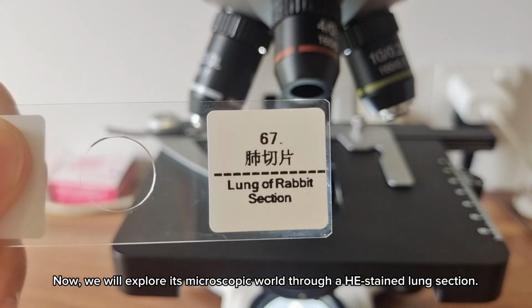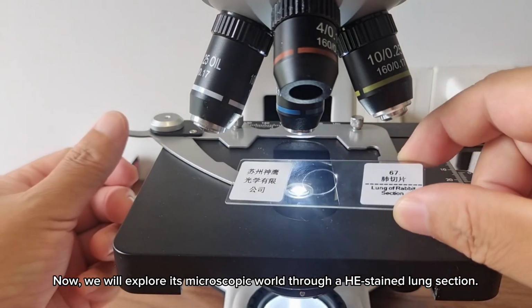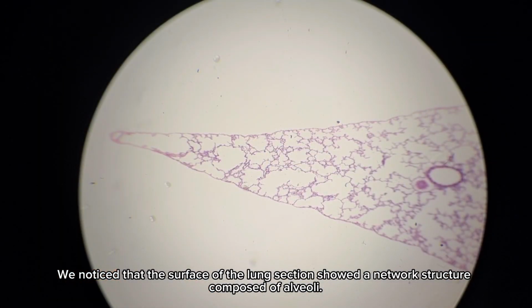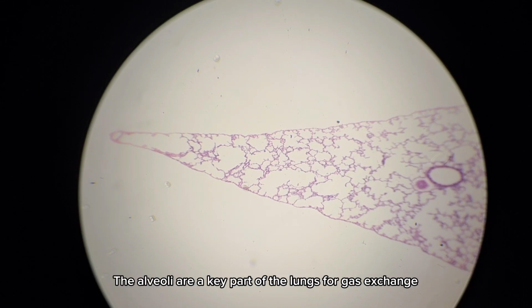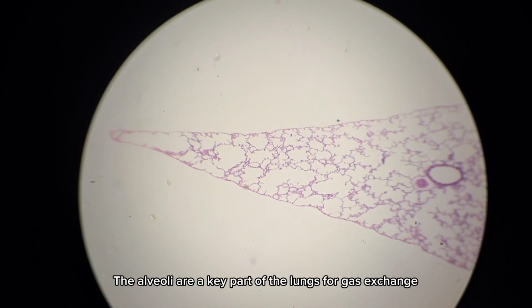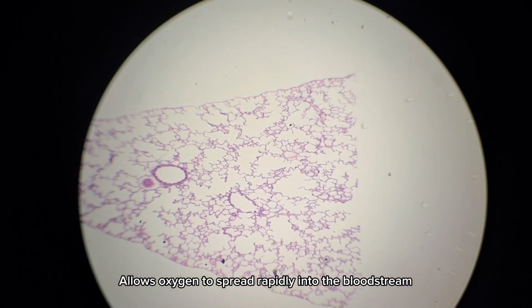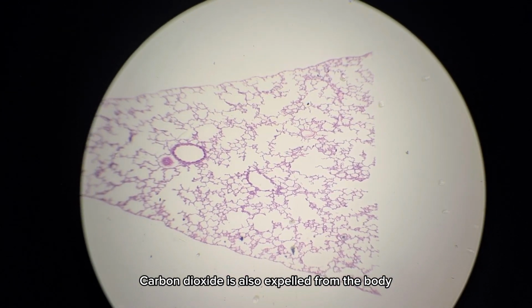Now, we will explore its microscopic world through an H&E-stained lung section. We noticed that the surface of the lung section showed a network structure composed of alveoli. The alveoli are a key part of the lungs for gas exchange. Their walls are thin, allowing oxygen to spread rapidly into the bloodstream. Carbon dioxide is also expelled from the body.